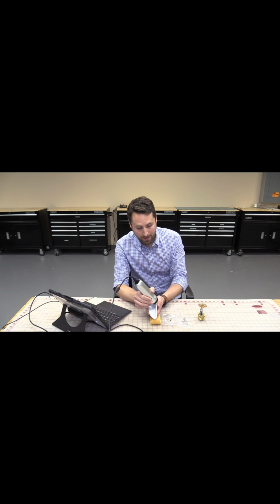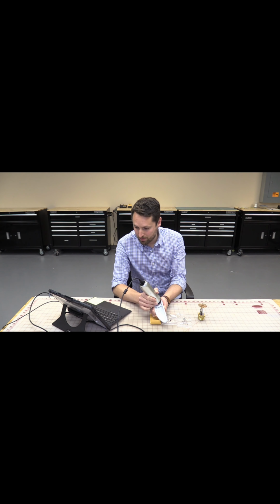If we go to the other side, we're able to see similar features all pointing in that downward direction. So that again is pointing us towards that origin. You continue to see that as we work our way down this sample. So we go around the bend, we're able to see again some more direction there. And once we hit this middle point, we're actually able to find the center.